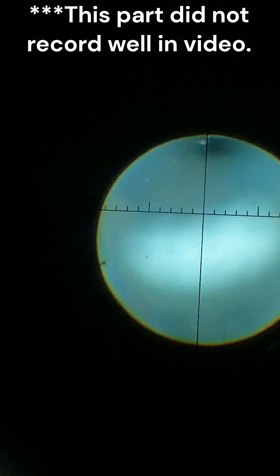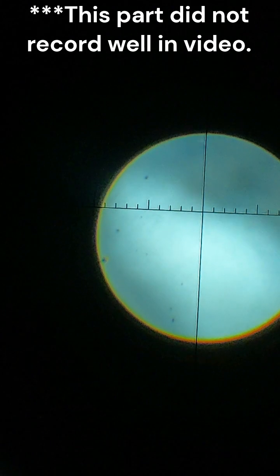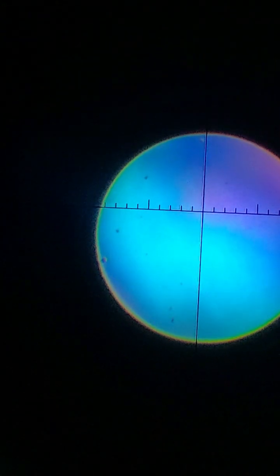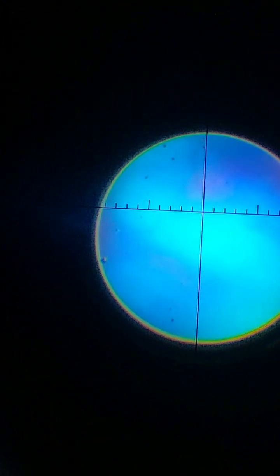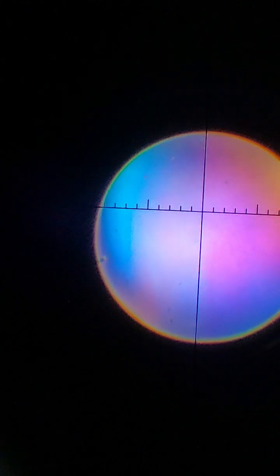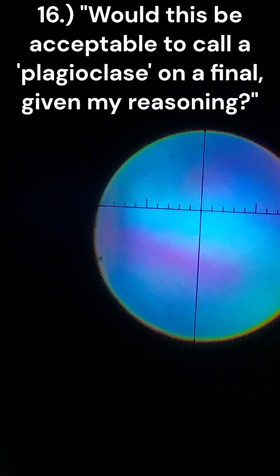So it's going to top left, bottom right, and then it's going to come inwards and then leave out there. And then putting on gypsum to get interference colors. Kind of looks like the blue's in the middle, and then isogyres come in, go away, come in, go back away.